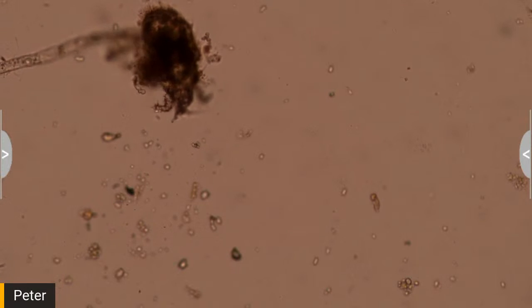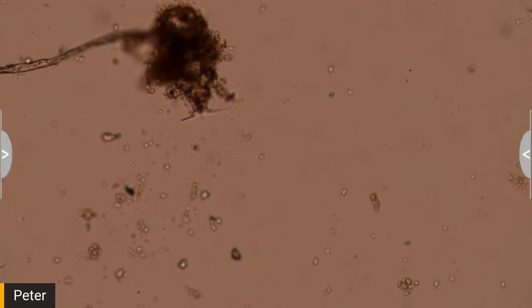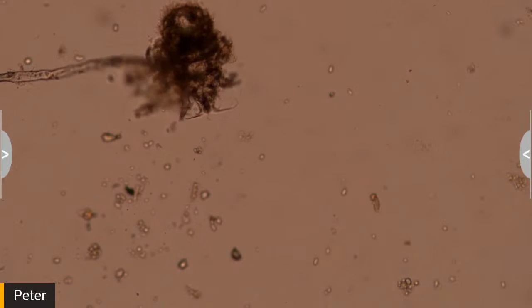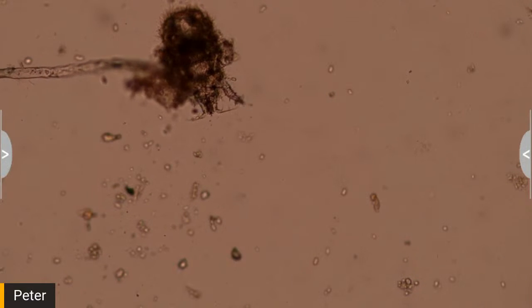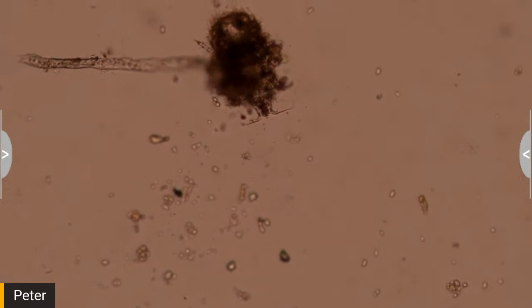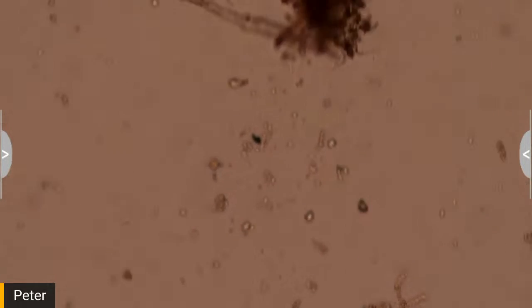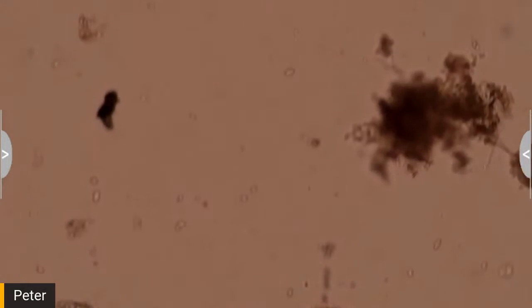Yeah, there's nothing right. You guys are all watching me set up my microscope. Alright, we'll come back to you.